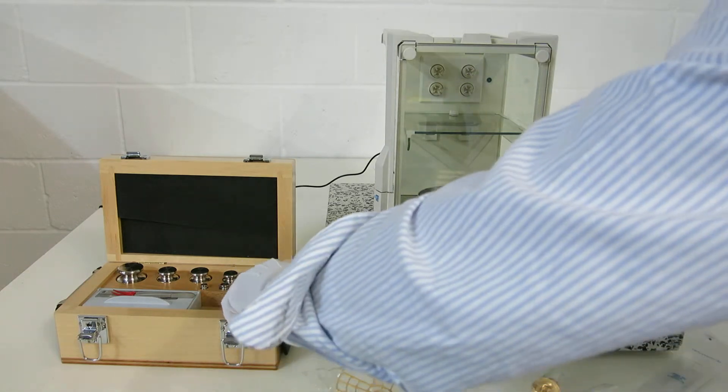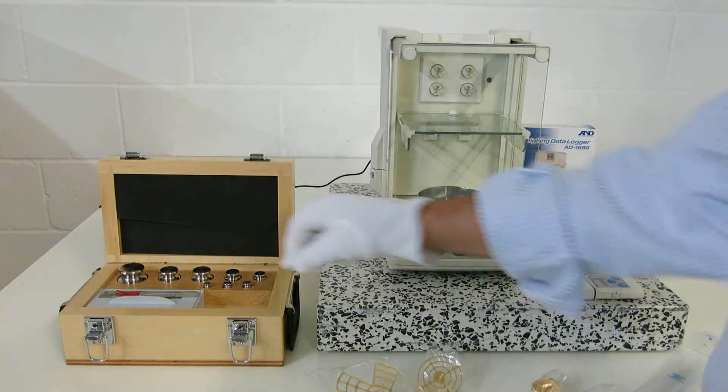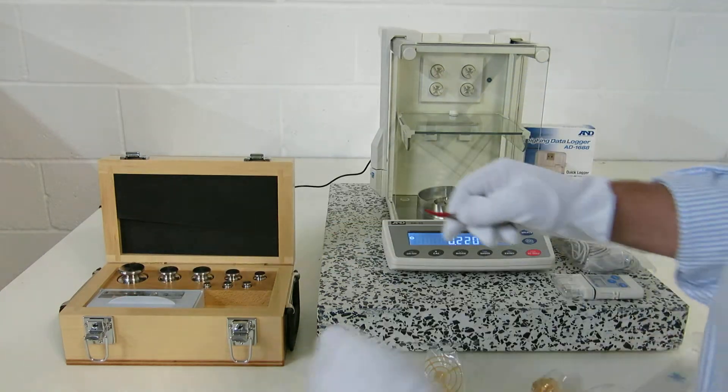Right, so let's go on to the instrument itself. Let's put a couple of weights on, let's see how we go on. So what we're going to do now is put a couple of weights on here. Let's have a look at this one.